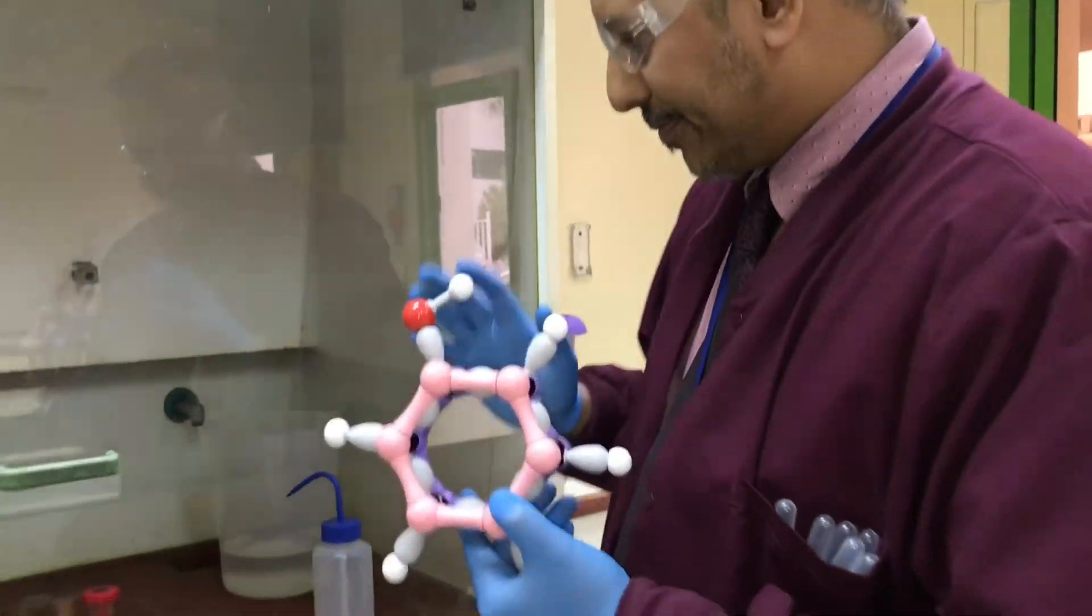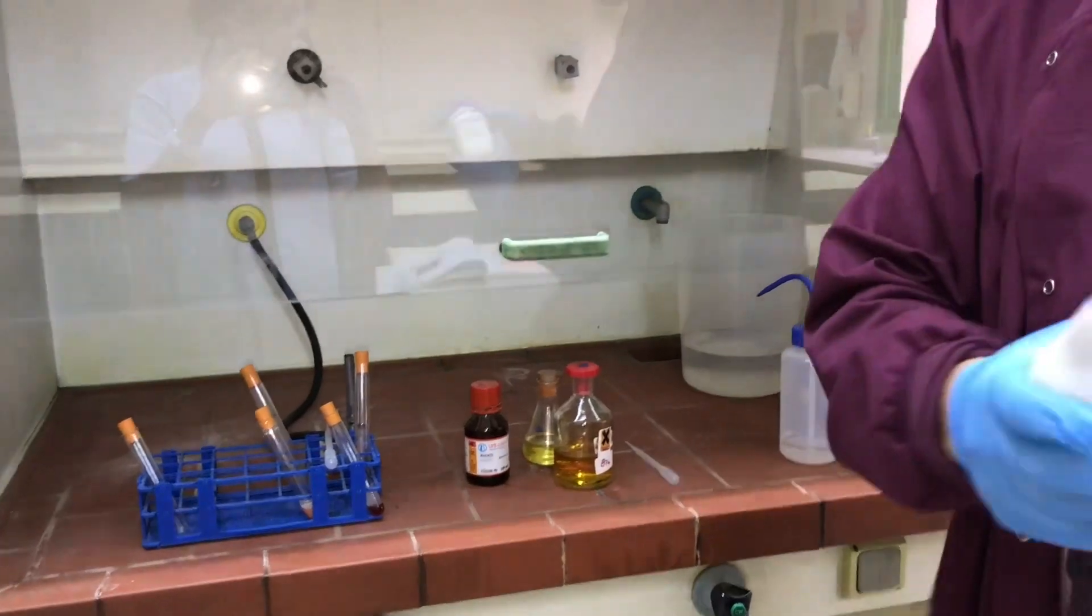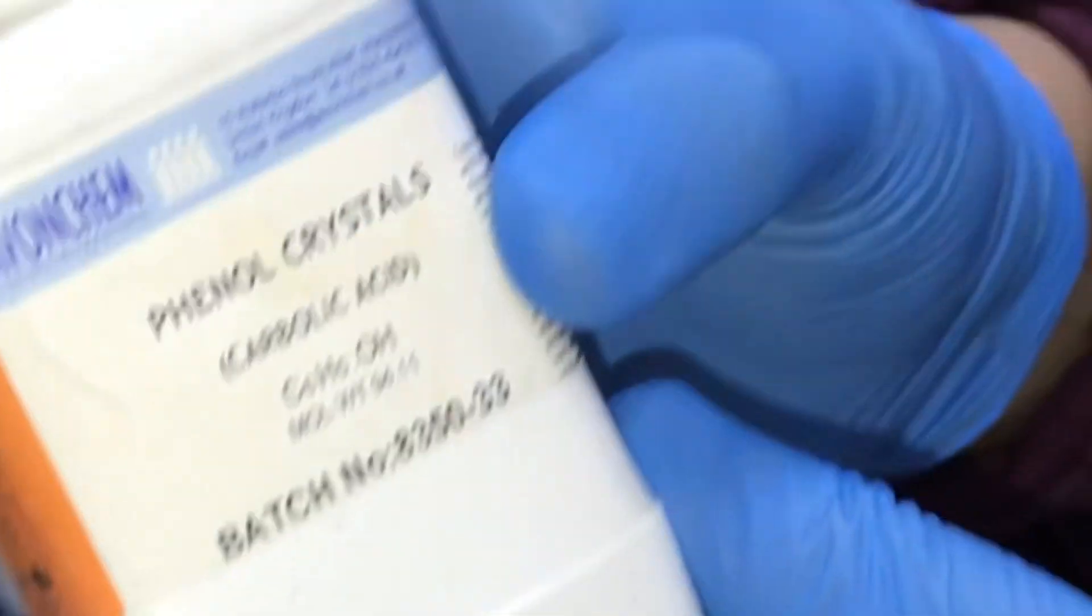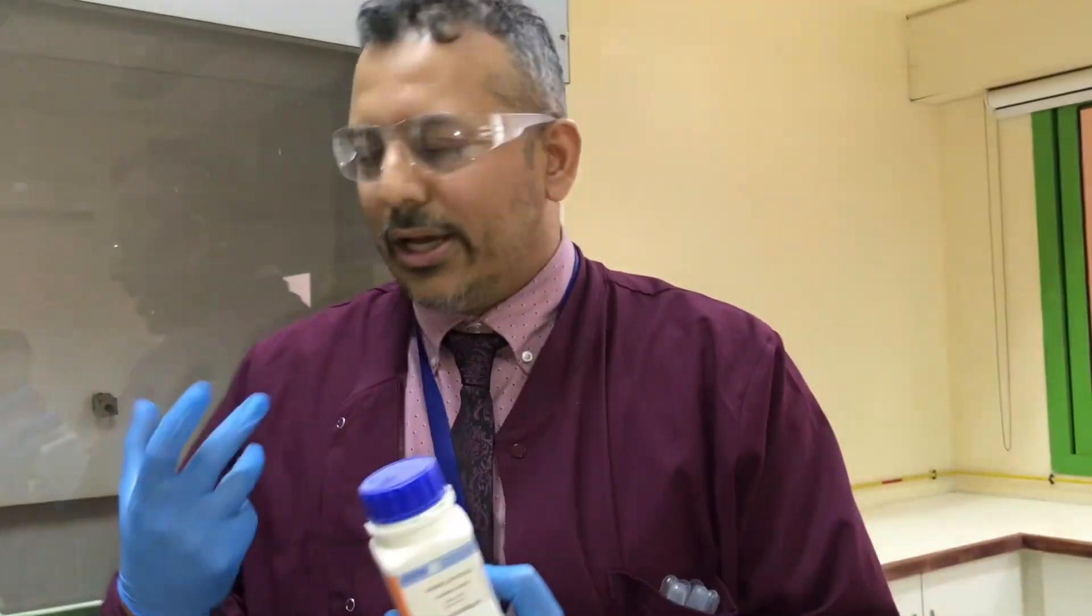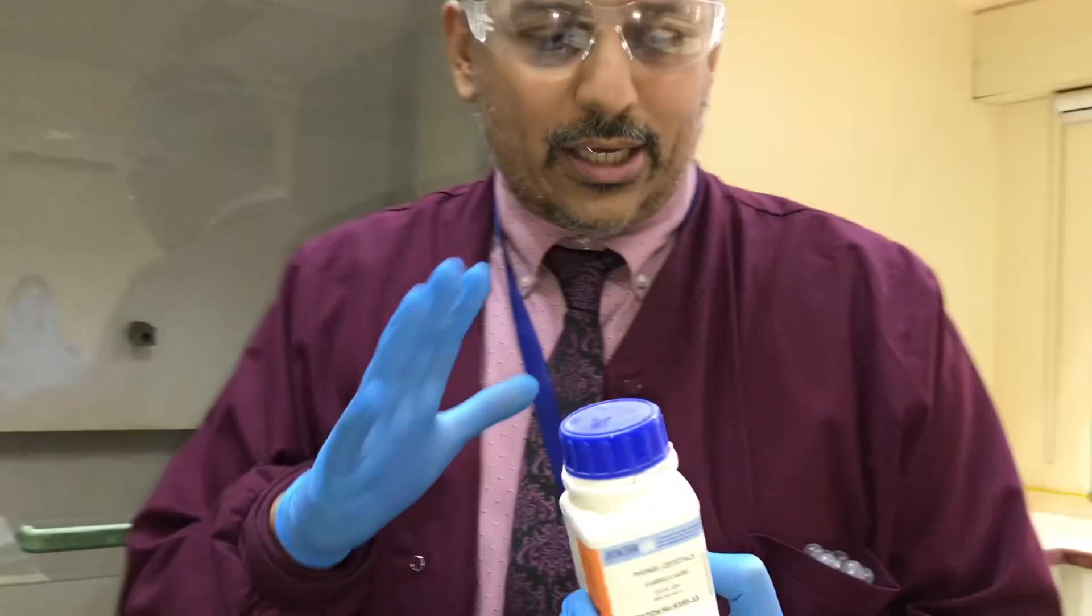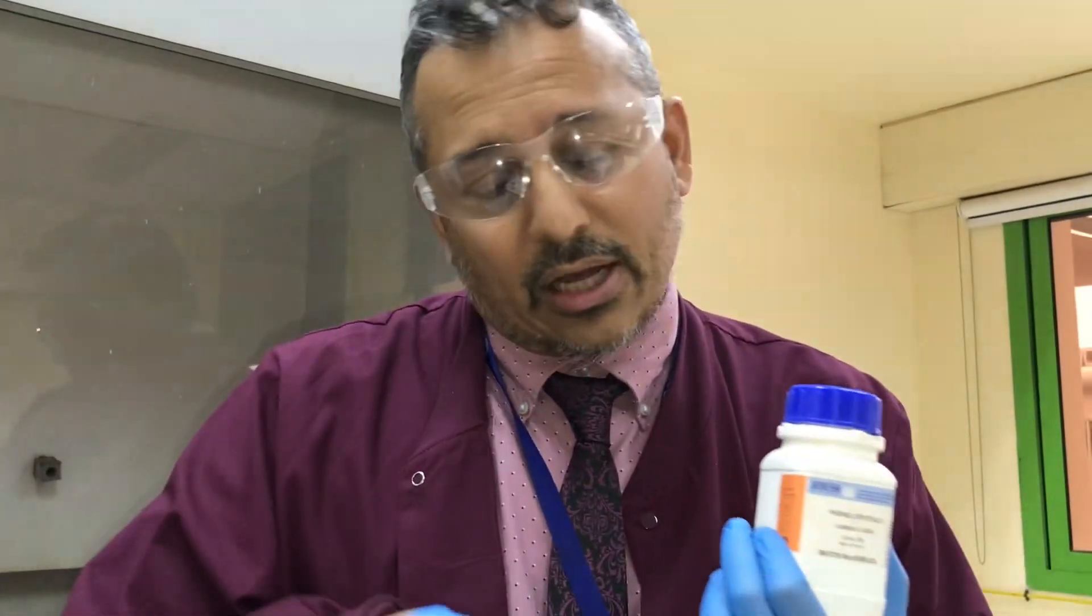Phenol is a really interesting chemical. I've got some phenol crystals over here. Another name for phenol is carbolic acid. Carbolic is related to things like tar and has an aromatic tarry smell, but you don't really want it wafting into the air too much because it is massively unpleasant to handle. It will kill you if you swallow it, so it's very toxic.